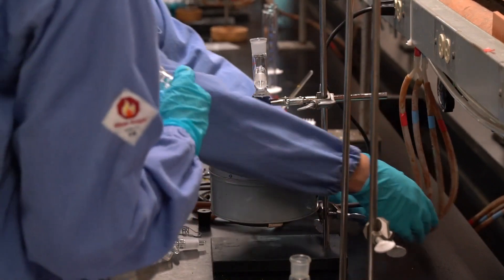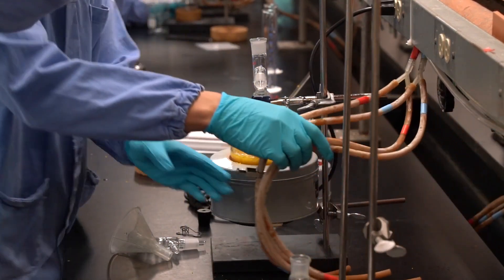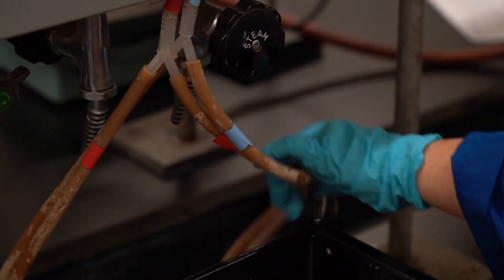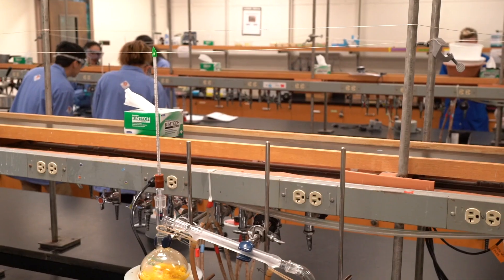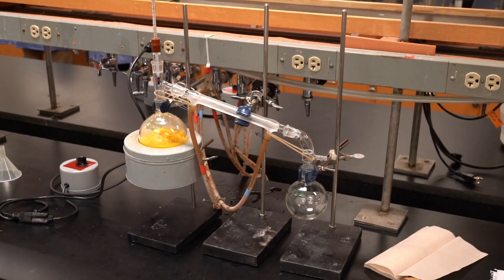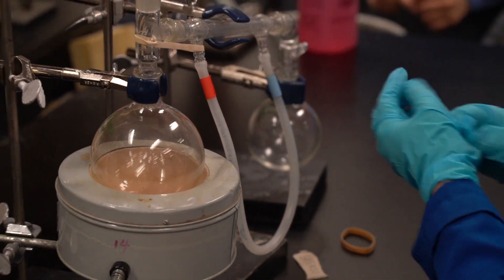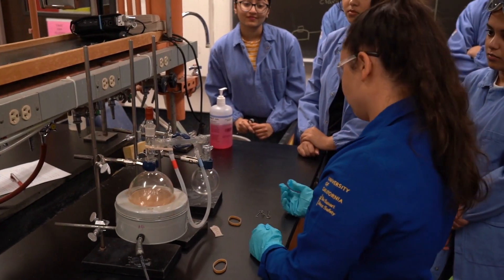So for this tubing that you actually have, there are going to be clamps. You want to keep them closed until you have set up the apparatus. Then you can let go of the clamps and the water will come rushing in. But you don't want the water going in right now because if you're going to disassemble it, it's just a pain.